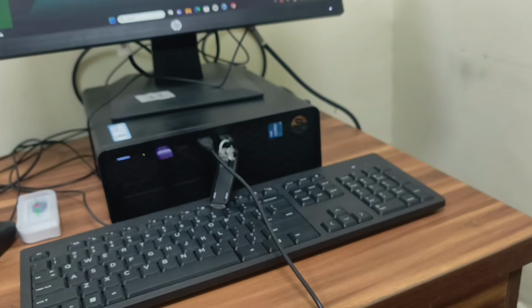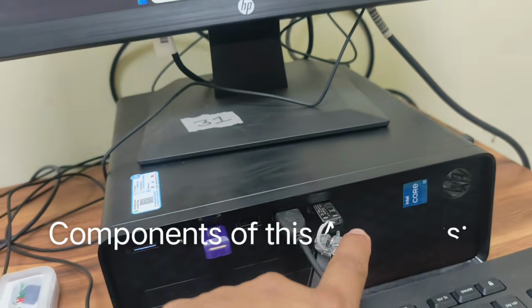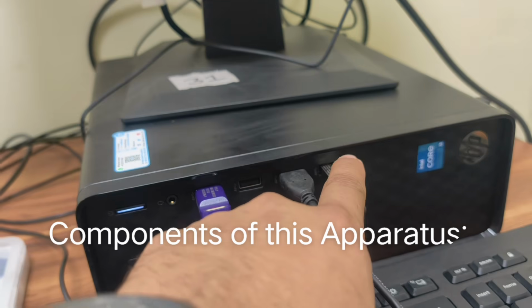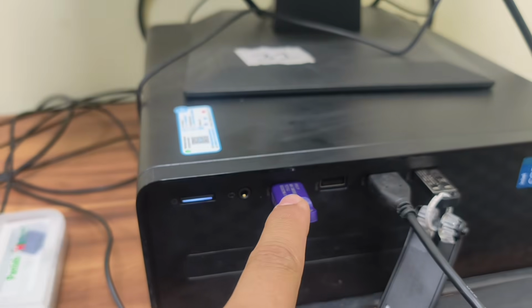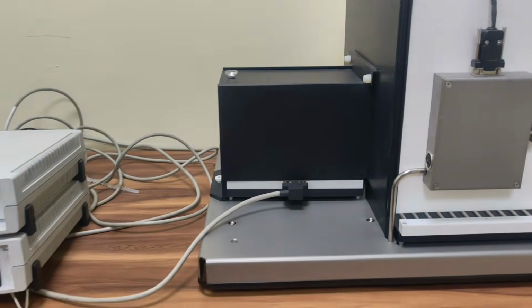Firstly, let us start with the software which we are using, which is provided by Panlab. It is called Shutavoid. Without this software pen drive, this Shutavoid cannot start. Also, this is the license. This is the dongle. For now, one license can support 8 such boxes.